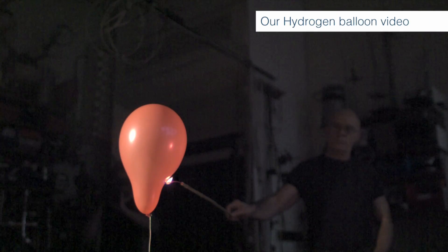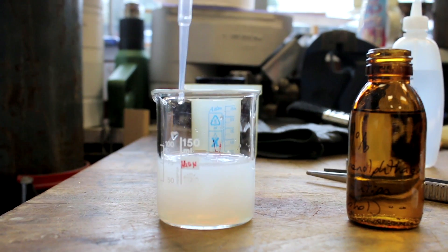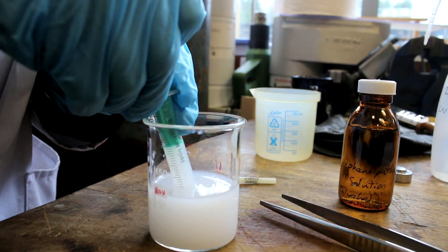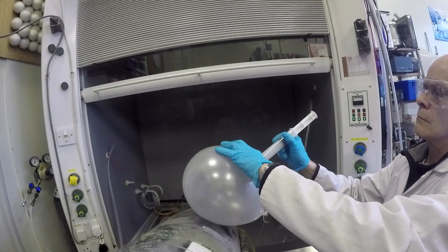The reason for this is that when you normally prick a balloon, when you make the first hole, the fabric runs from that hole and a slit goes up through the fabric and it breaks. But if you have the rubber held by sticky tape, it can't move. So we had the idea that we should try injecting water with phenolphthalein into the balloon.